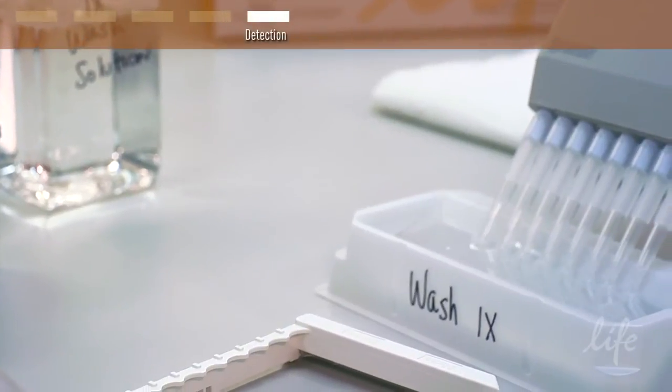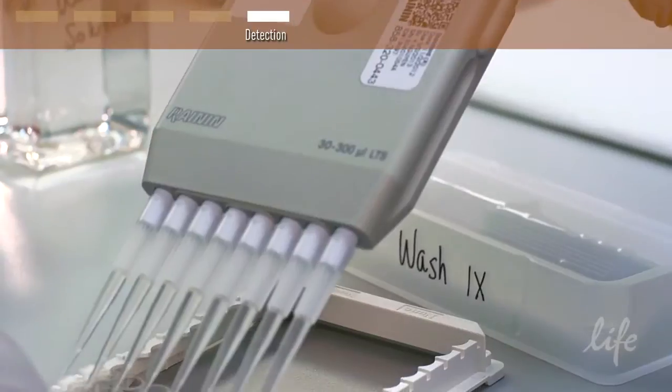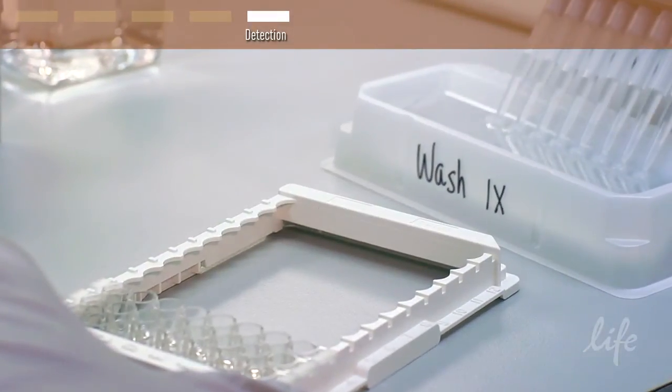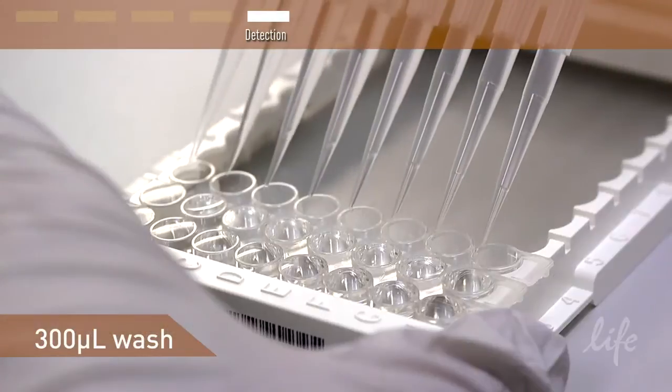After incubation, remove the standards and samples and wash the plate either manually or with an automated plate washer. Add 300 microliters wash buffer per well and decant or aspirate. Repeat 3 more times to complete the wash cycle.